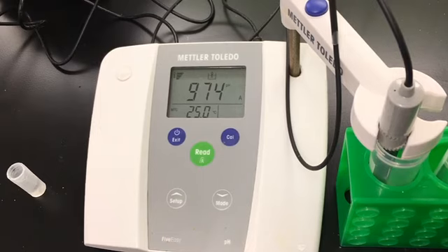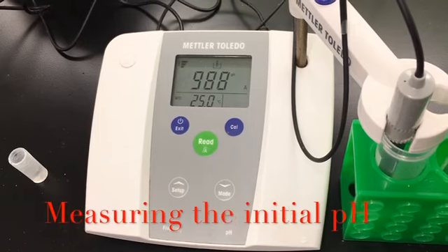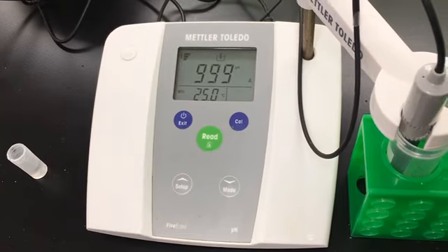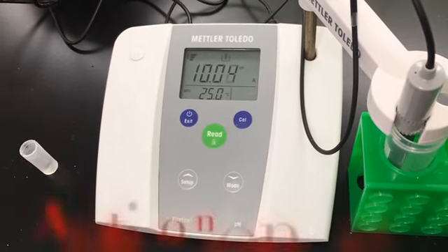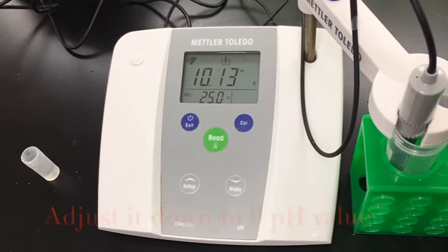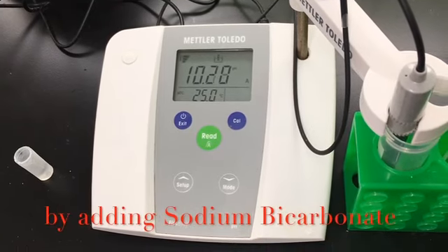So right now we're getting the pH of the 0.5% sodium hypochlorite, the solution that you prepared. Okay, and we want to adjust it down to pH 9. And we are going to adjust the pH with the sodium bicarbonate.